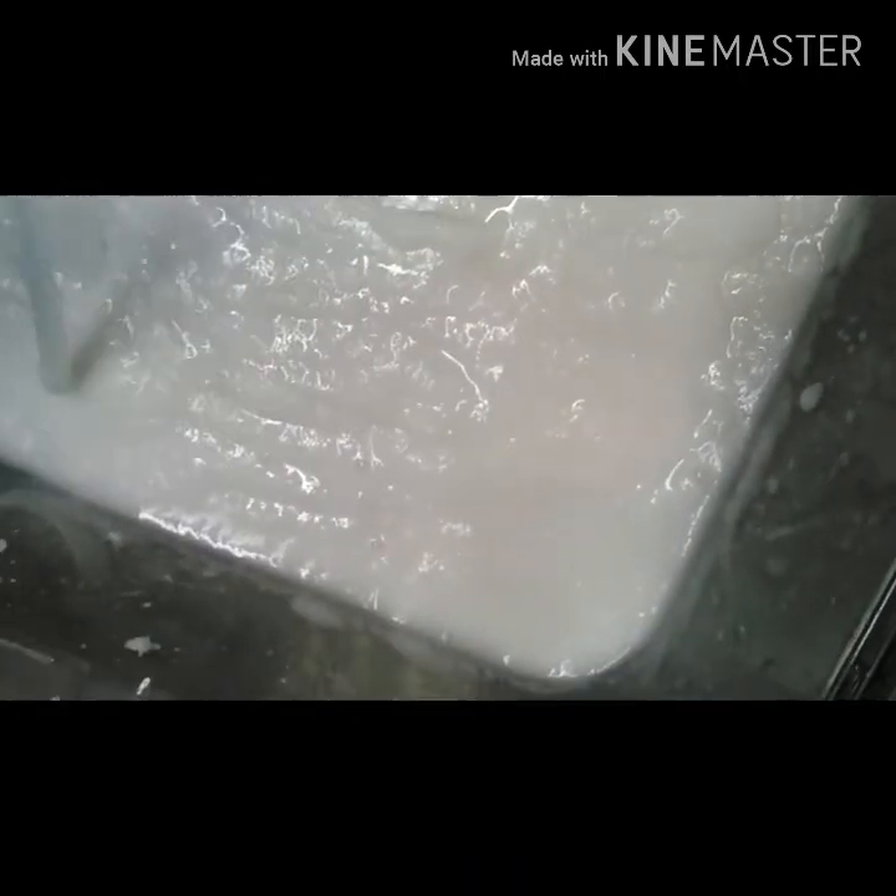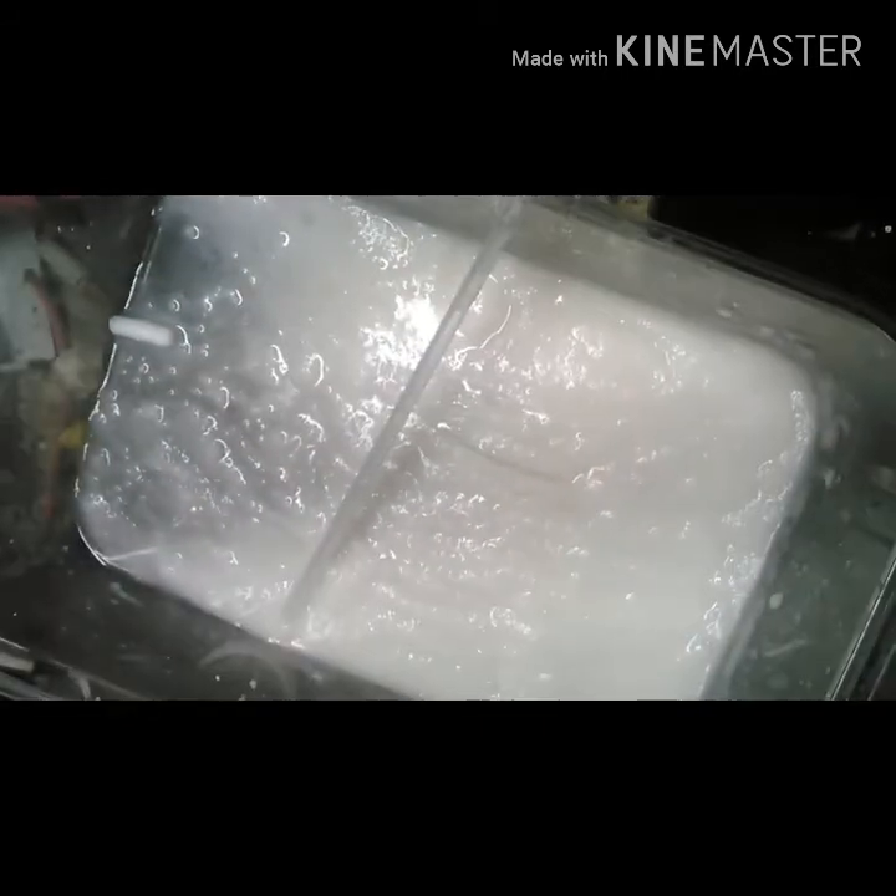I'm all done. You can see there's still a little bit of water in here. For cleanup, the sodium nitrate is super water soluble, so you just add a little bit of water and it will come right out. Once this is dry, you should get needle-like crystals. And that's everything — till the next one guys.